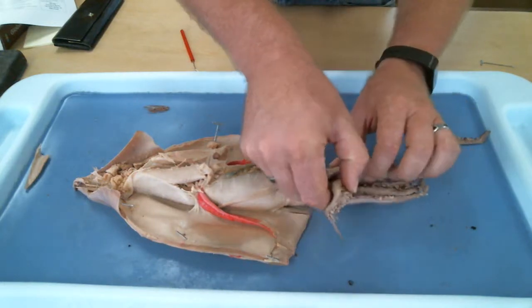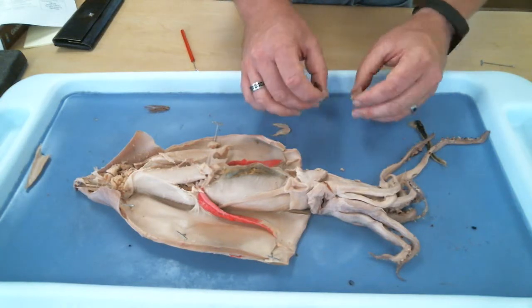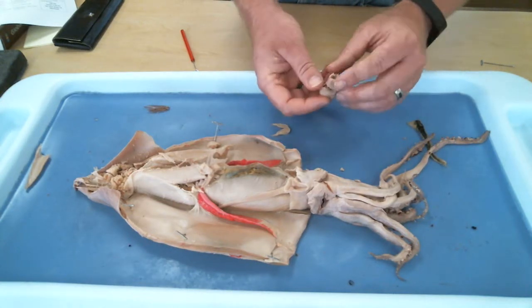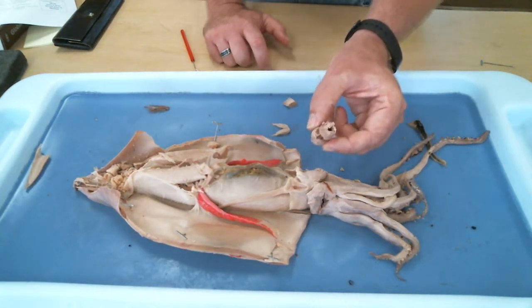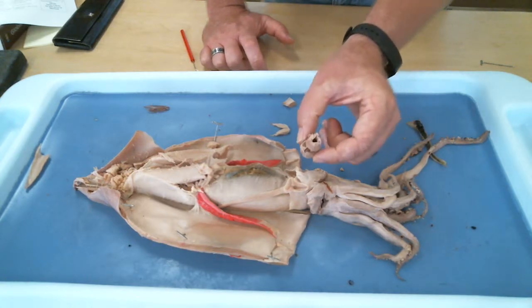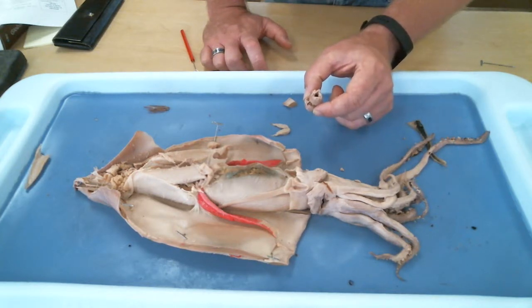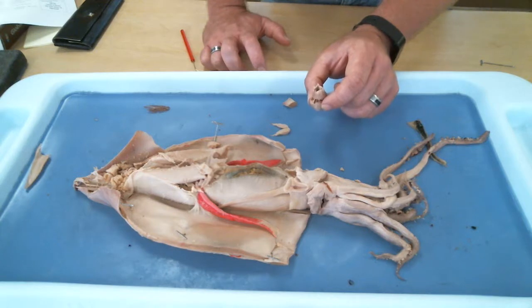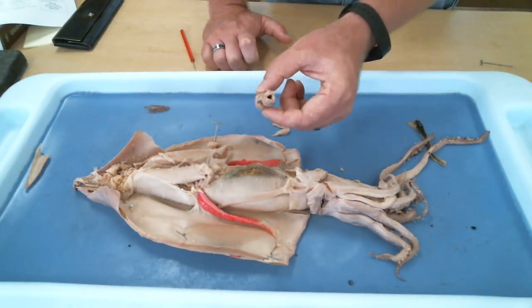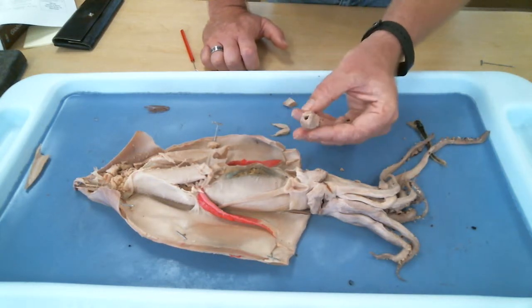If you open up the arms of the squid, this has been removed out, but this structure was like this inside there. What is this whole thing called? The whole mouth part. Something bulb. It is something bulb. Does anybody remember what it's called? The buccal bulb. Buccal means mouth. So the buccal bulb, this is the ball thing that serves as his mouth. The buccal, B-U-C-C-A-L, bulb.